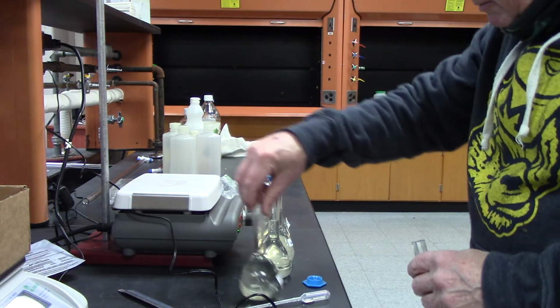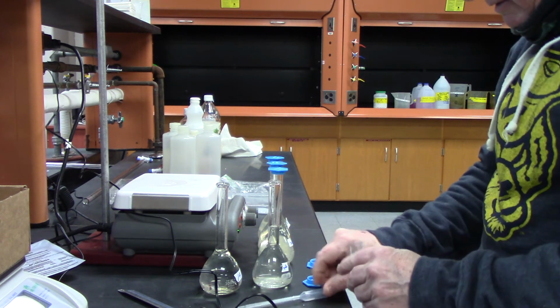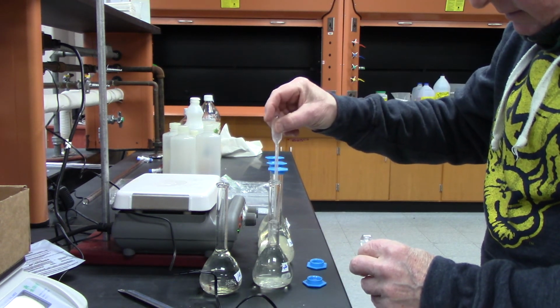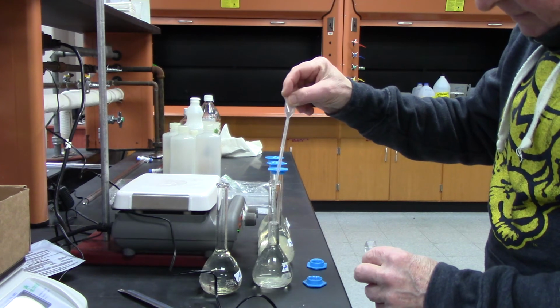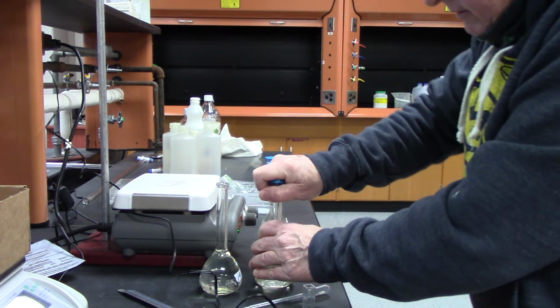Now I'm going to go to number 2. I'll stir this up a little better.